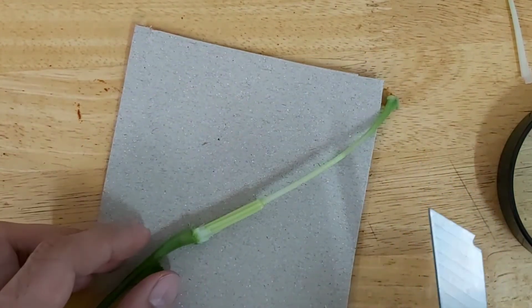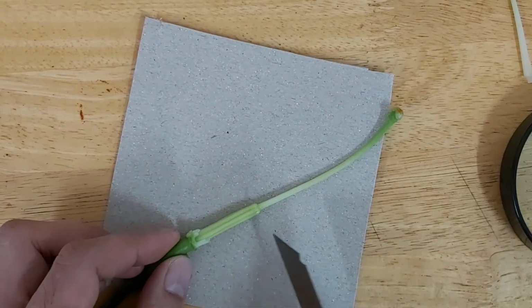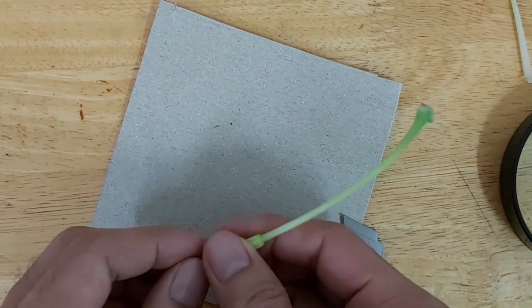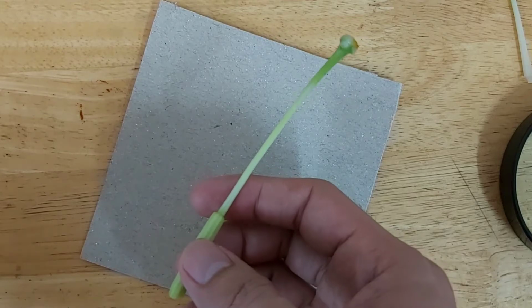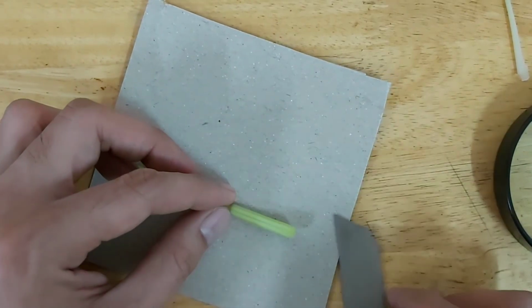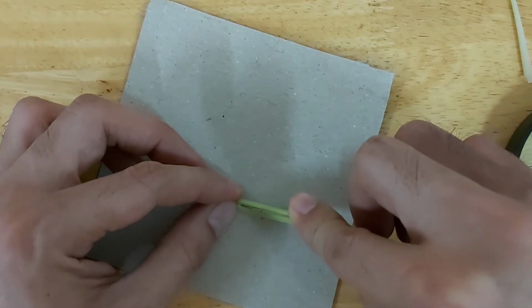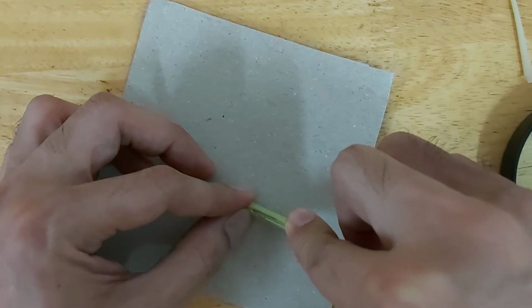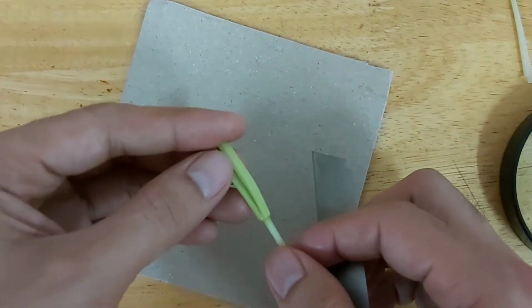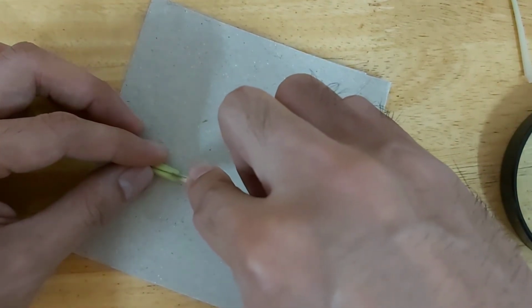A reminder, class: when you are working with a sharp object, be careful, and as much as possible it should be with the supervision of your parents or any adult, for us to avoid accident. First, we are going to detach the carpel from the flower stalk. And then we are going to cut it lengthwise. Here we have the ovary, so we're just going to cut it lengthwise. And then we go to the style. Let's cut the style lengthwise.